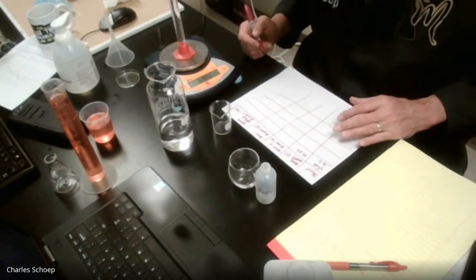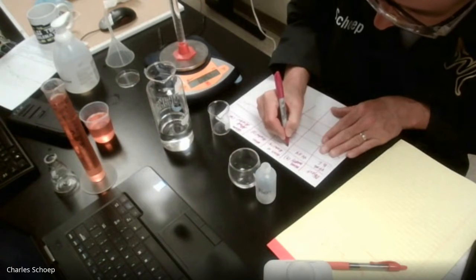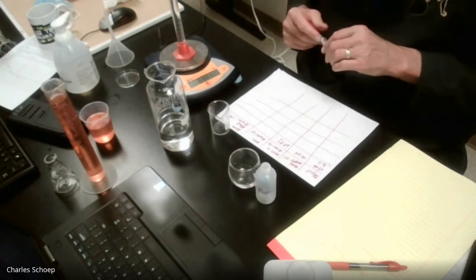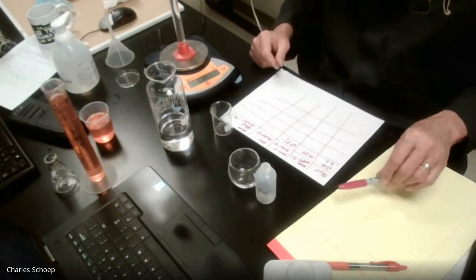Okay. 69.92. So we go up to 69.92. And we're going to calculate this guy here in a minute, so we're not going to worry about that.